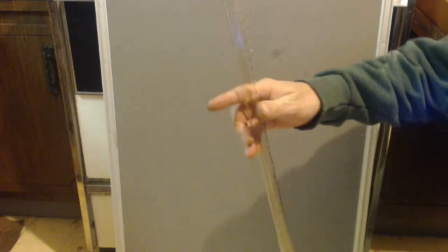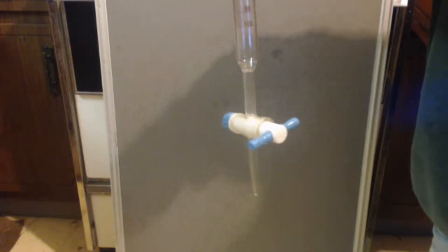I just wanted to show my burettes, I think they're called — I'm not actually sure what they're called. But this one's a 100 milliliter and the other one is 50. It's basically a volumetric column except it has this stopcock at the bottom. You use it for titrations. That way you get an exact reading — cause when you titrate something, you might only use like a couple milliliters of stuff, and you want it to be exact.